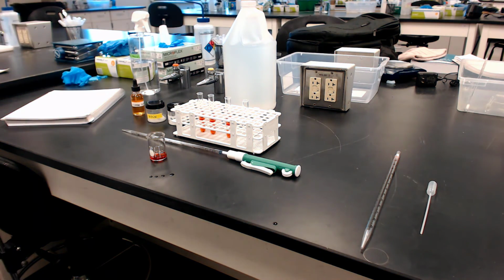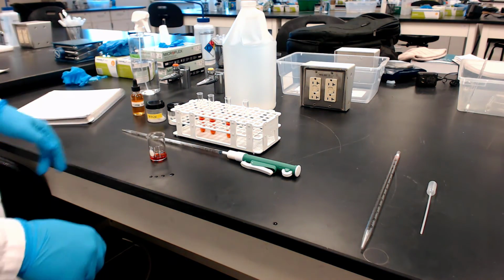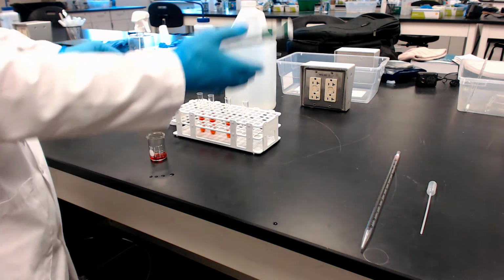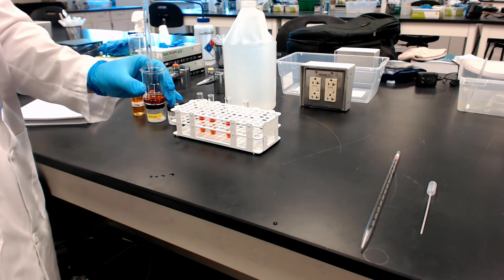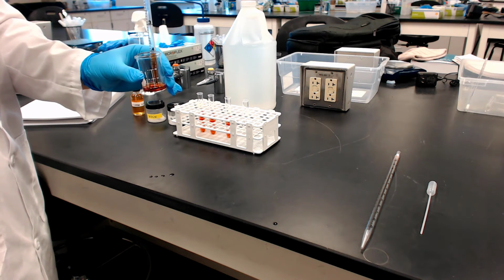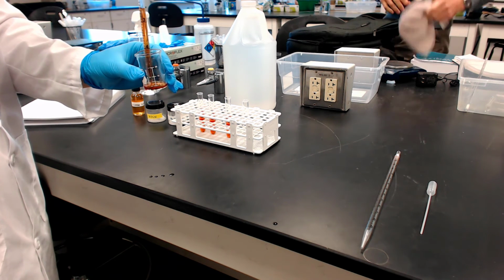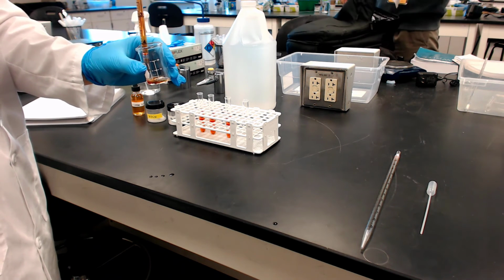All right. So now we're back to our last tube. Correction made. And again, if he had measured that, it's kind of qualitative work. He could just basically run the 5 mils out, or he could just pour out of the beaker at this point.